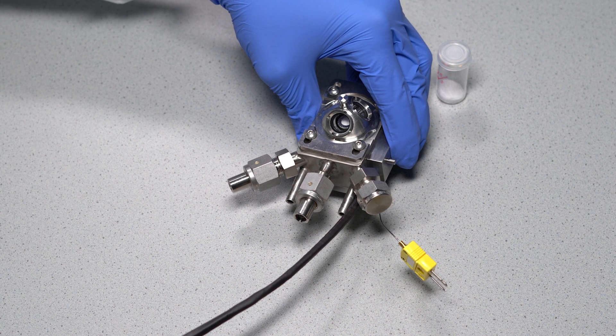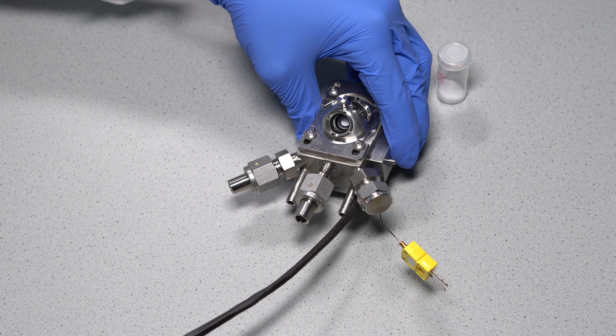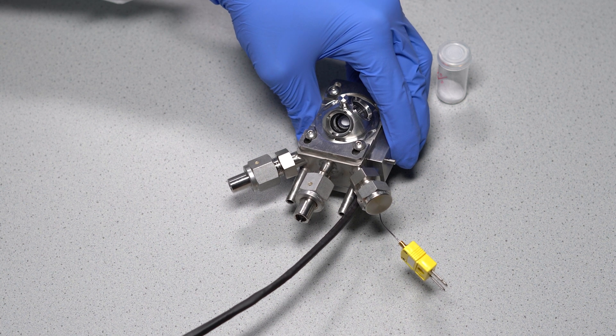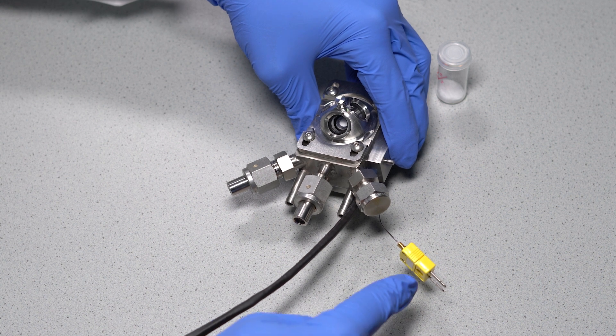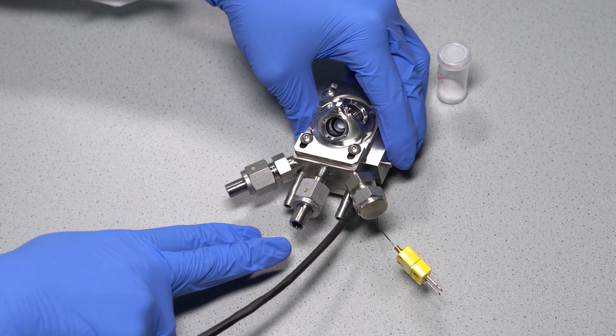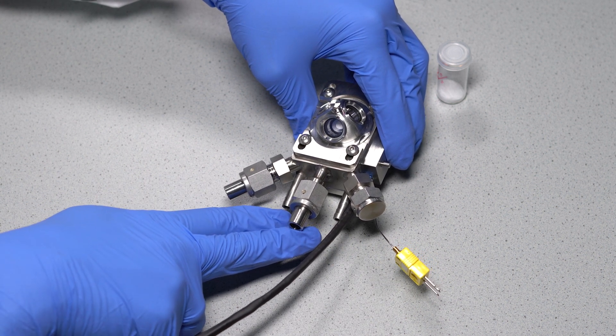In addition, the reaction chamber also offers the possibility to carry out the investigations at high temperatures via a heating element. The electric current and the cooling water for controlling the temperature on the chamber are supplied through these connectors.